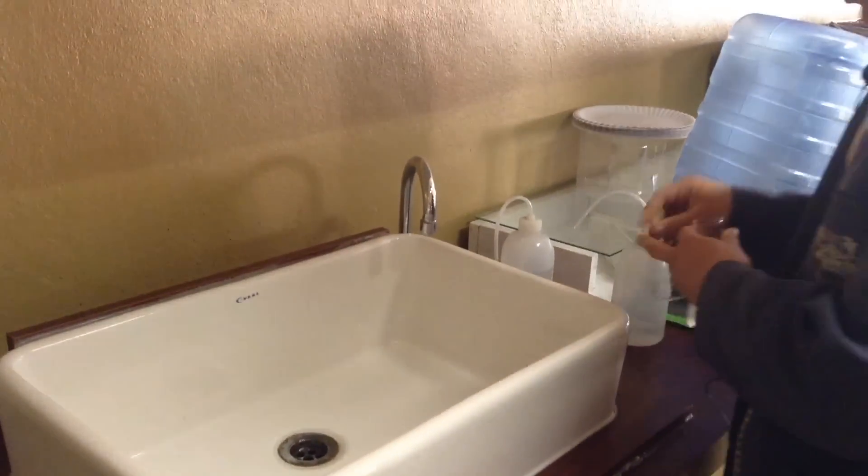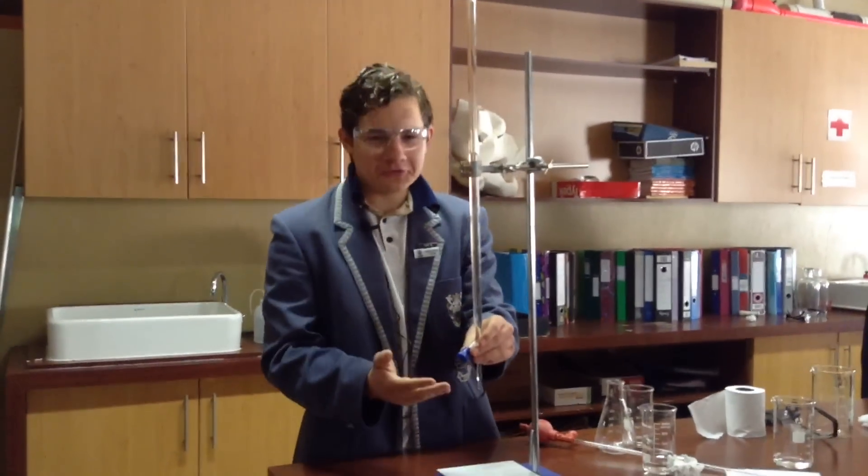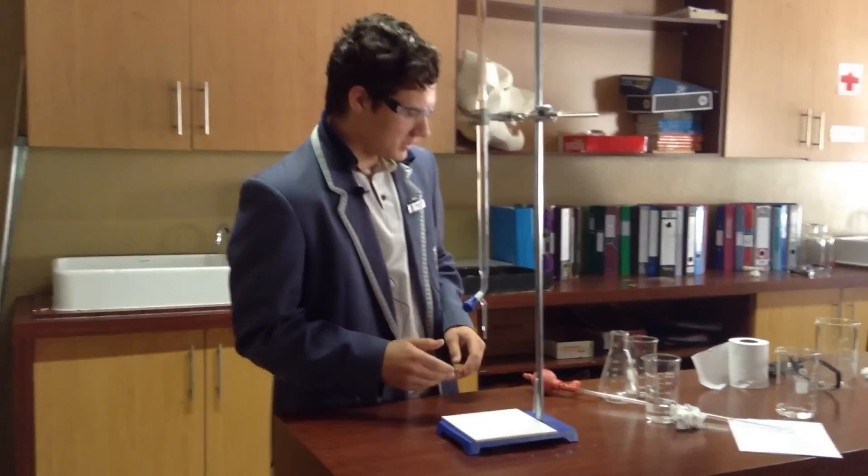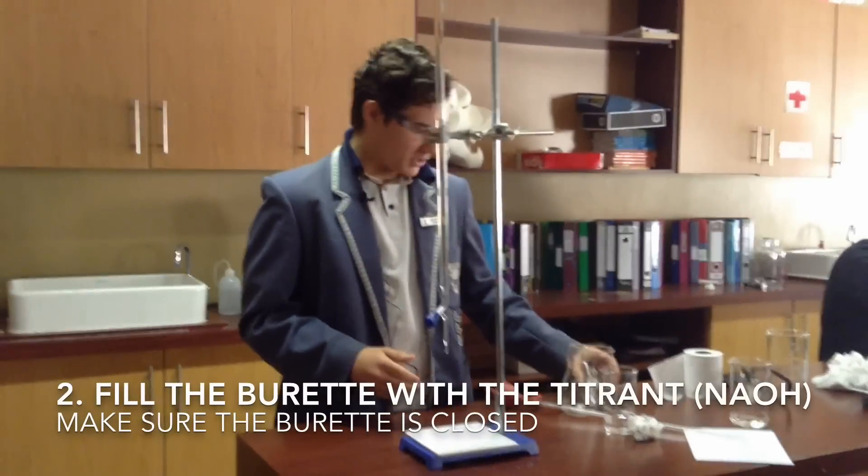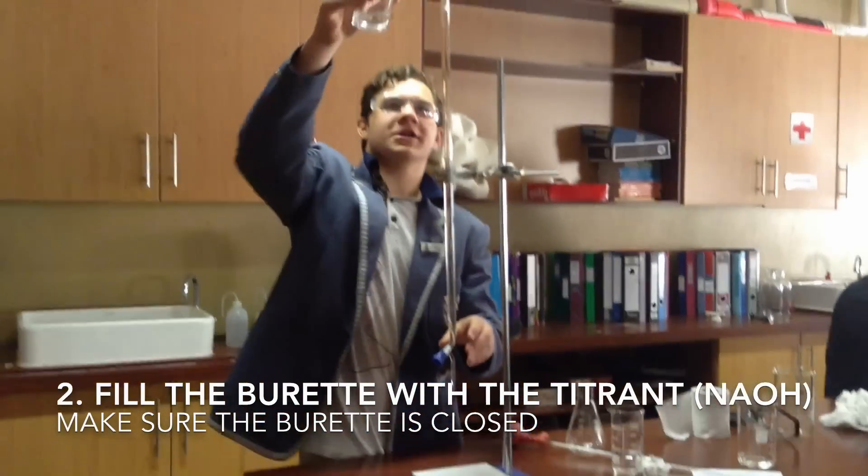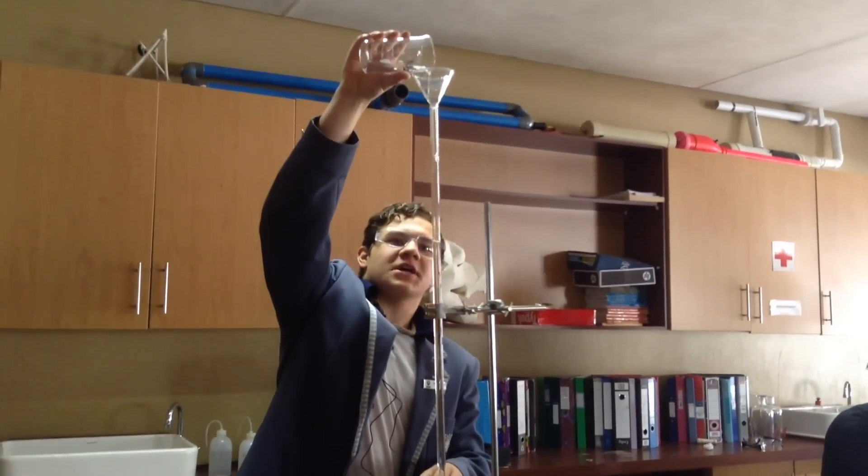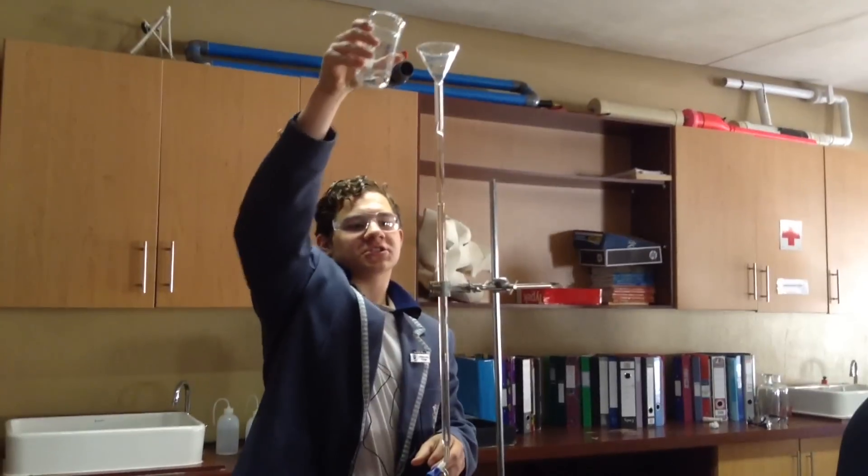Okay, so it's important to make sure your burette is closed, otherwise your NaOH is just going to flow out. So we're going to take our NaOH and we're just going to fill our burette, making sure it's closed. And once again, it doesn't have to be at zero, it just has to be at a reading.